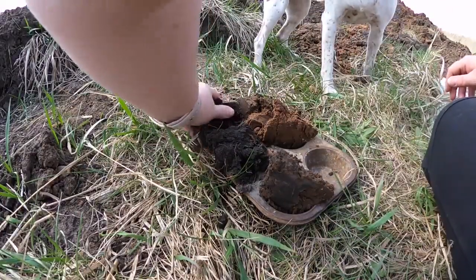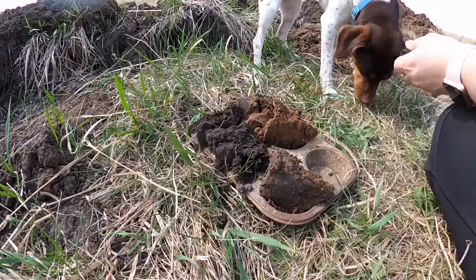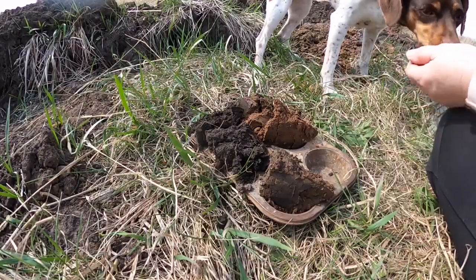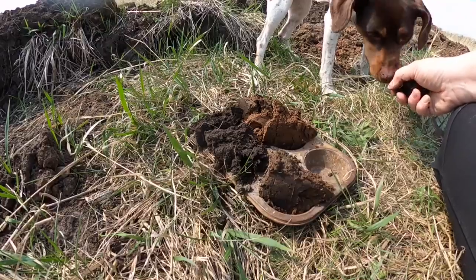For the first sample, I'm going to take it and we want to do a rubbed color. There's plenty of moisture in this but I'll go ahead and work up a bit of a texture ball anyway, just to make sure — just rubbed up a little bit.